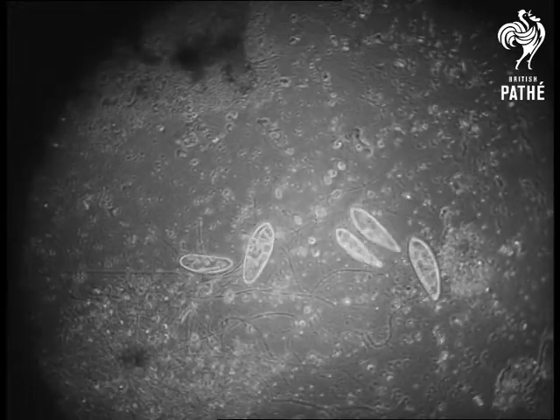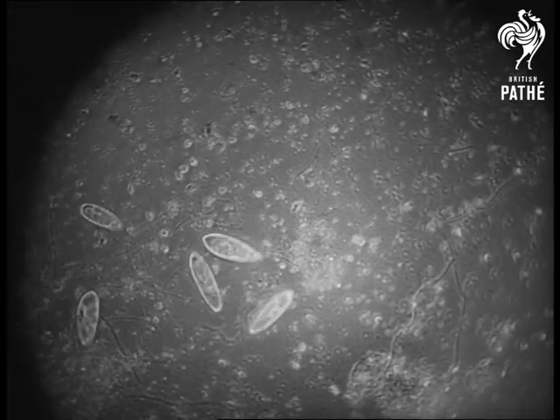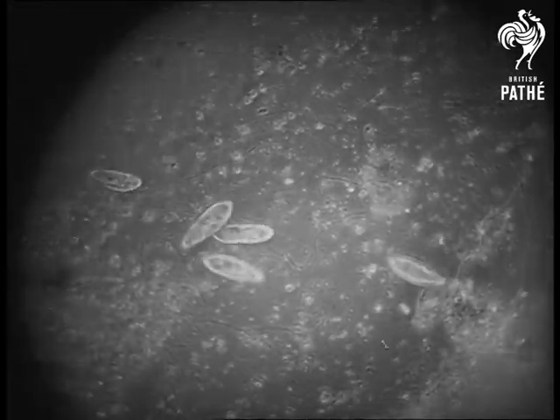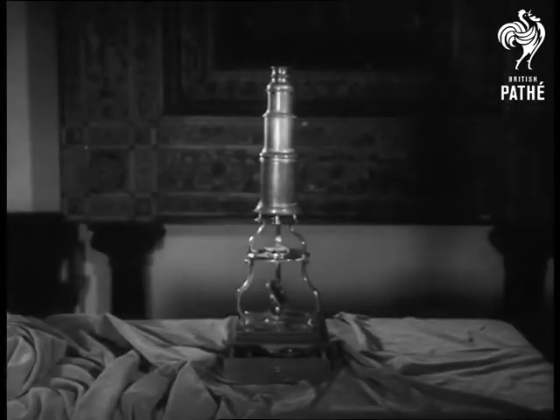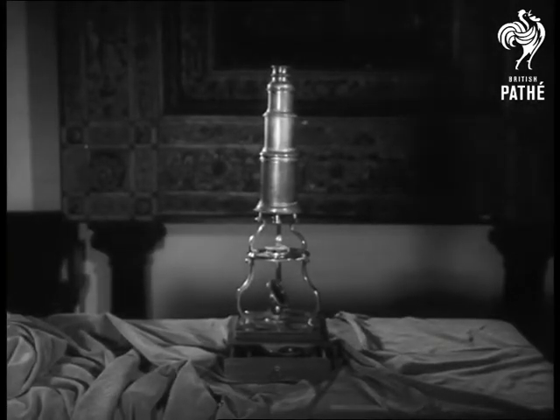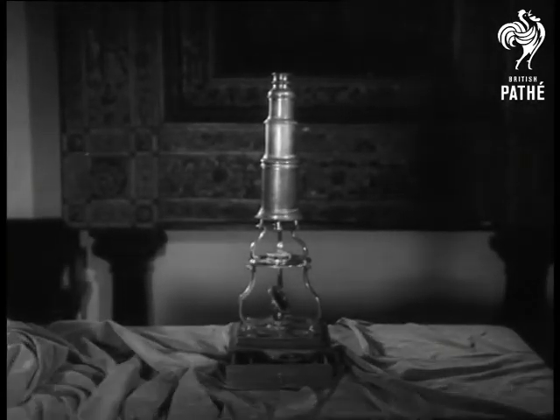Organic life in a drop of water, seen by scientists through the miracle of the microscope. Known as early as the 15th century, the microscope has developed as a tool of science.